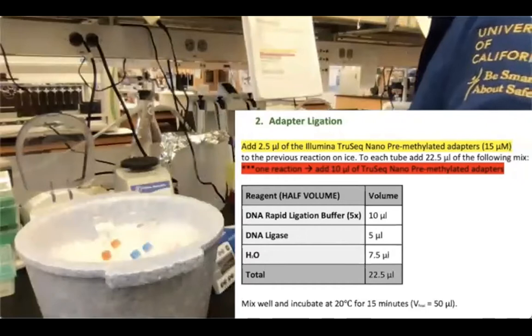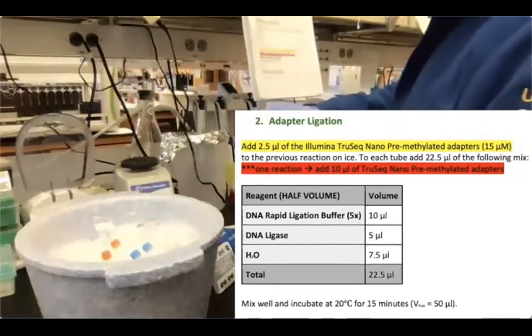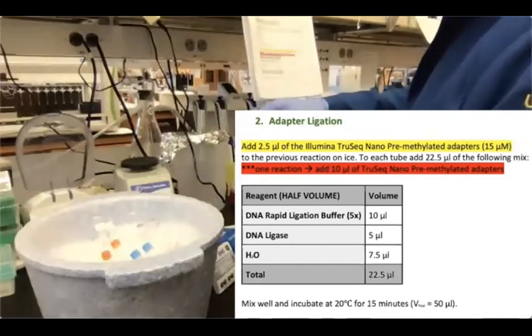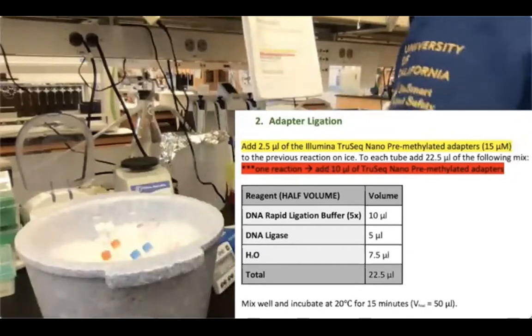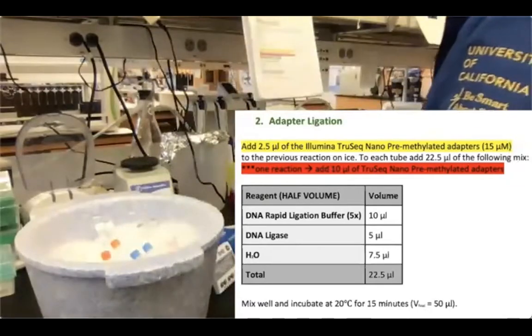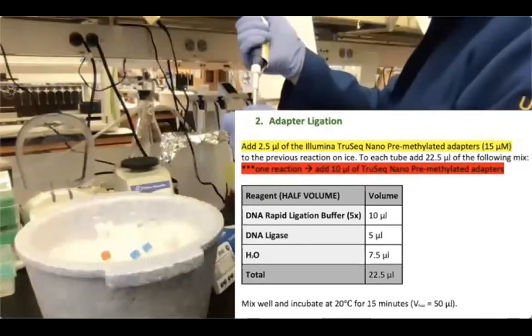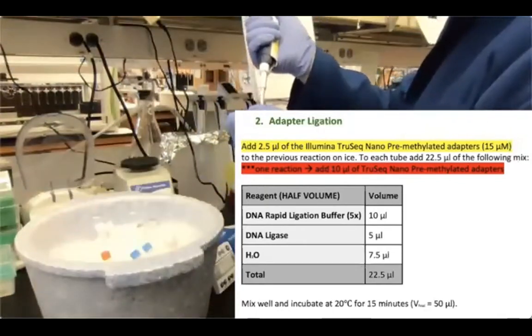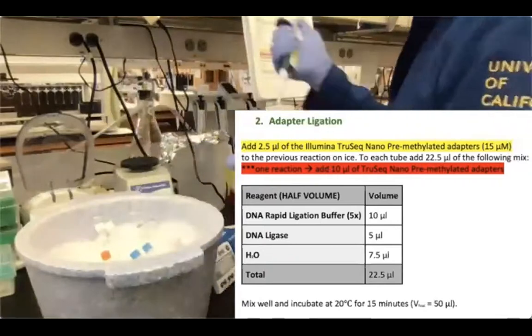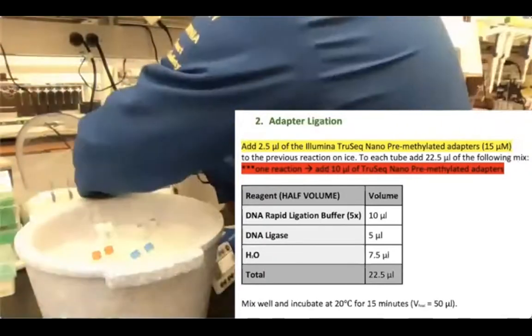After I've added the buffer, I can add the water for sample A, which has 7.5 microliters less in terms of volume. And then I'm adding 5 microliters of my ligase into each sample. Also, the ligase, like every enzyme, is very viscous, so please pipette slowly. So now I can mix my samples.